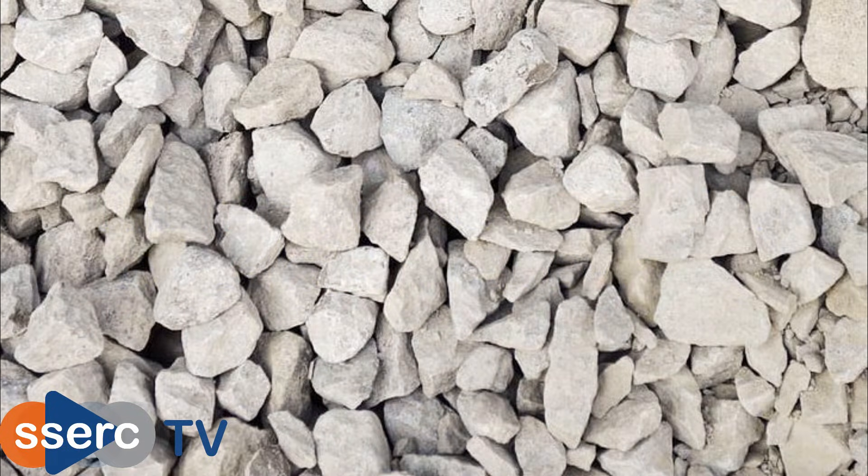Hi everyone, today we're going to look at the decomposition of calcium carbonate in the form of limestone, well marble chips.